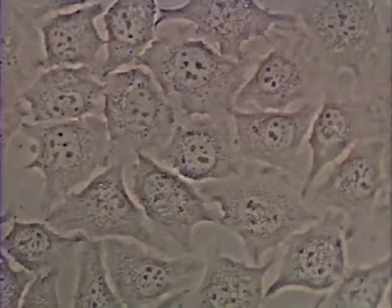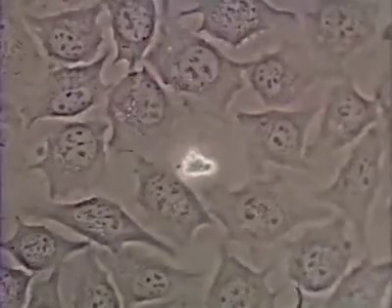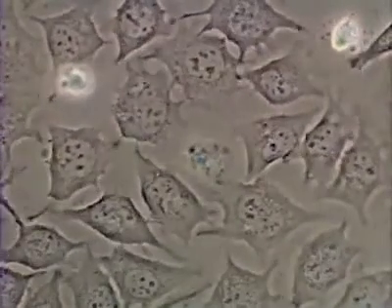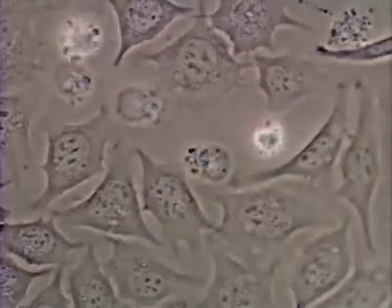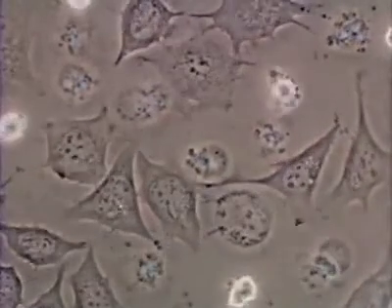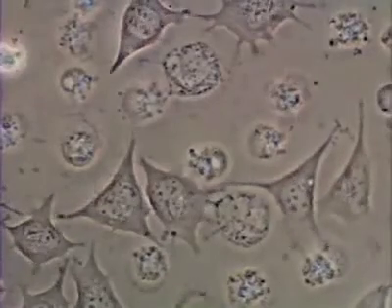Apoptosis, a form of programmed cell death, has been induced in these cultured cells. Cell death is characterized by blebbing of the plasma membrane and fragmentation of the nuclei. Suddenly, cells weaken attachment to the substratum that they have been growing on and shrivel up without lysing. In the following movies, we observe the process at higher magnification.